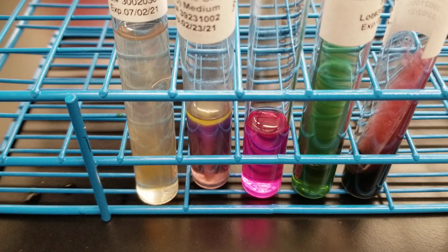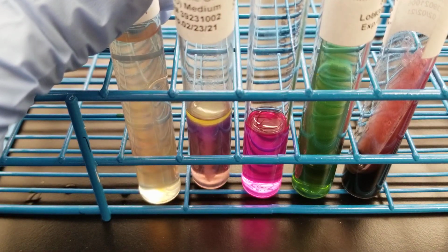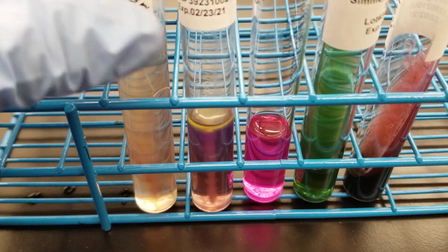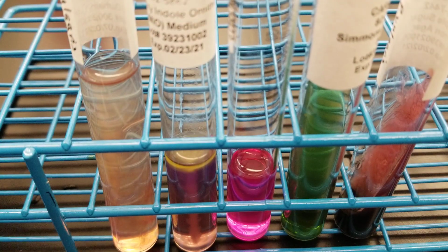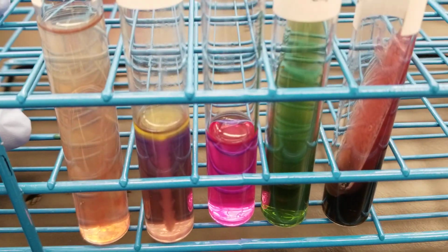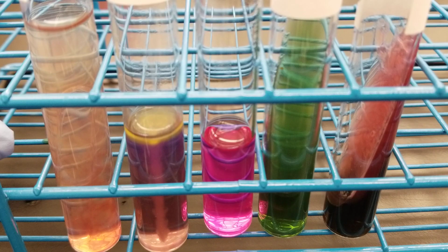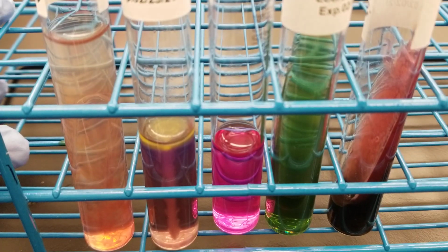So I'm just going to go with that because that seems to be a historical thing with our organisms here. All right, let's go with this red. Oh, there's the red. It's already turning red. So this looks good. This is what you would end up getting from our organism in the laboratory for Proteus vulgaris. All right, we're going to move on to the next one.